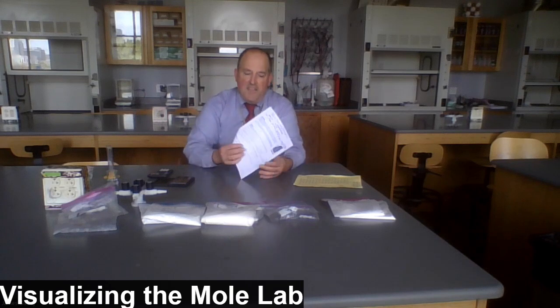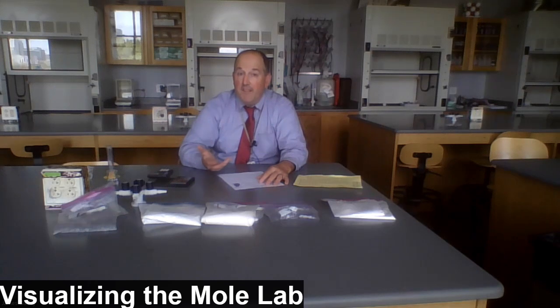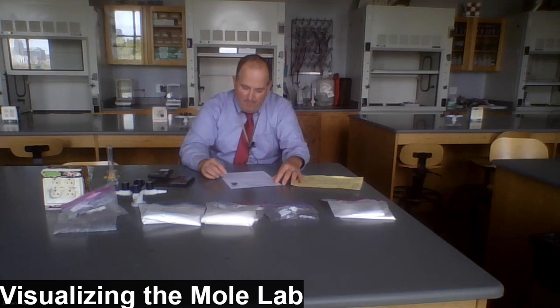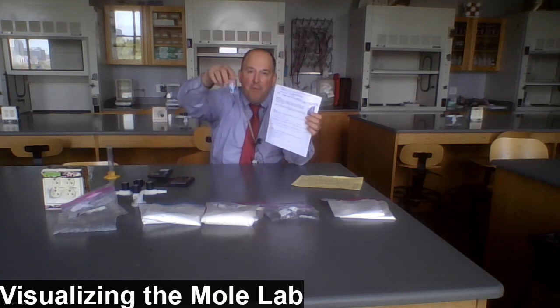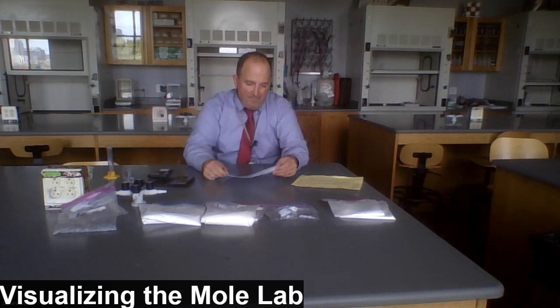So each of the stations in this lab are going to end with a question, and the answer should always be the same. How many molecules would be present in this sample of the gas? Well, if it's 1 mole, guess what, students? It's going to be Avogadro's number of molecules. 6.02 times 10 to the 23rd. Even up above, it says how many molecules of water are in our sample here. 6.02 times 10 to the 23rd.